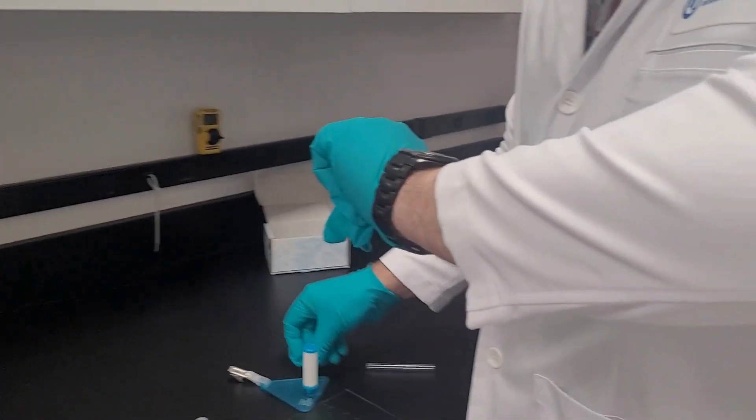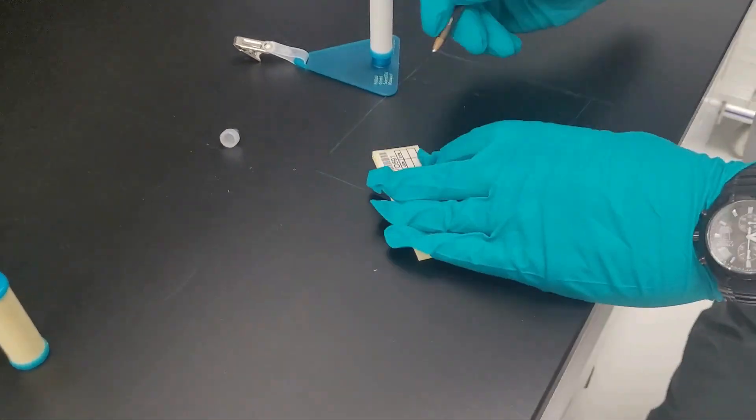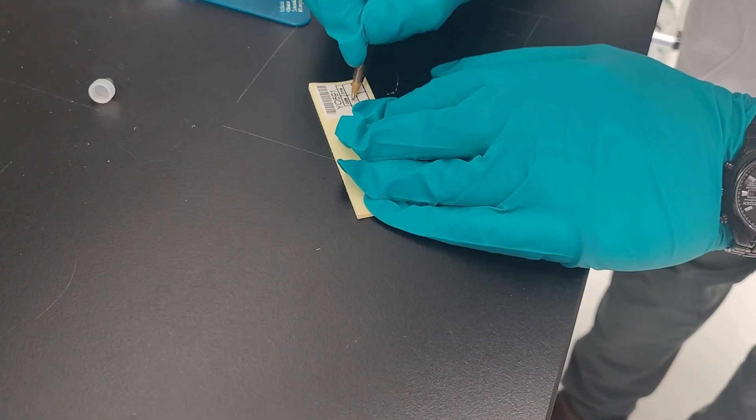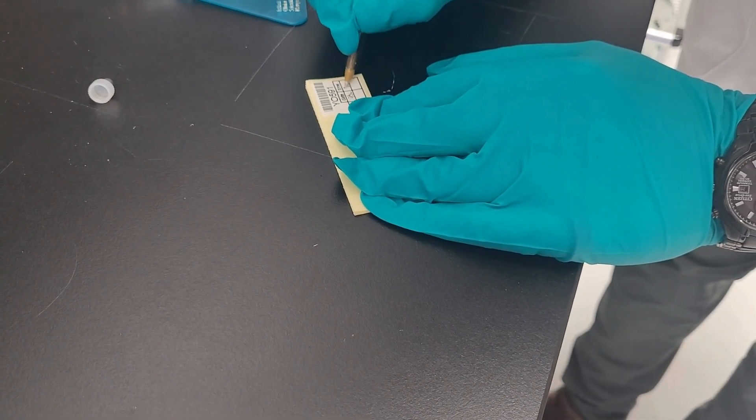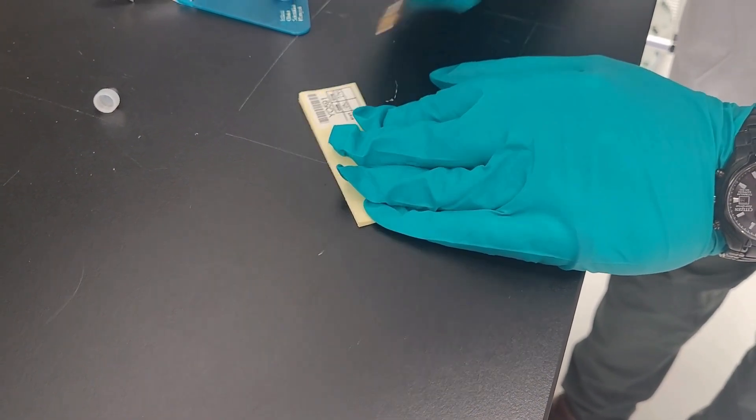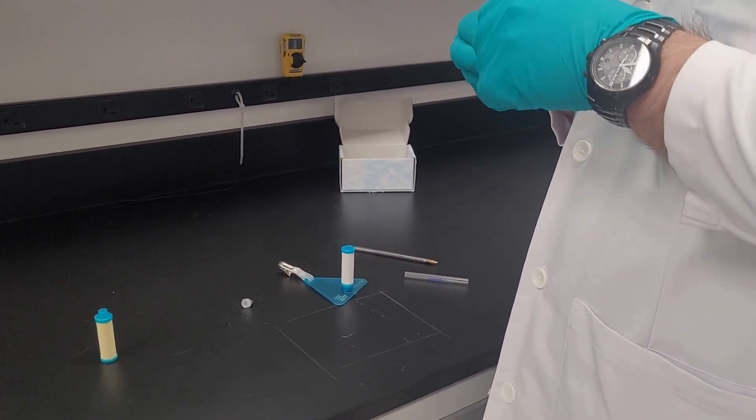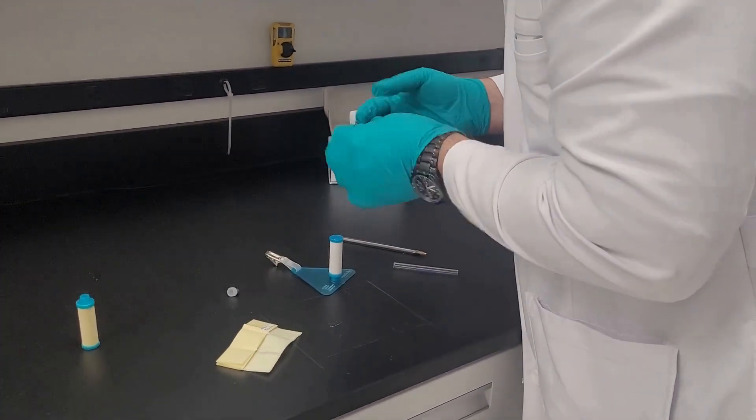We're going to look at the time and currently it is 9:40 and it is 10/30 and we are going to write down the date. We are going to replace that and place it right on our supporting plate as the start time.